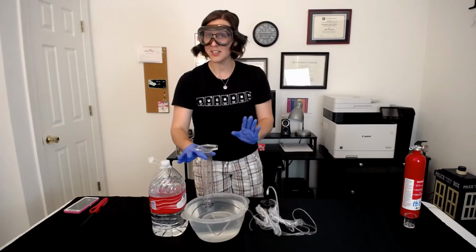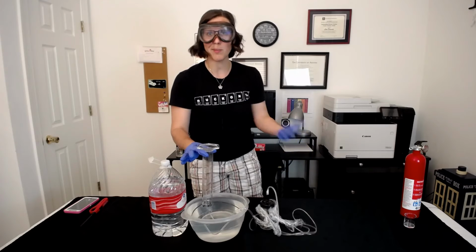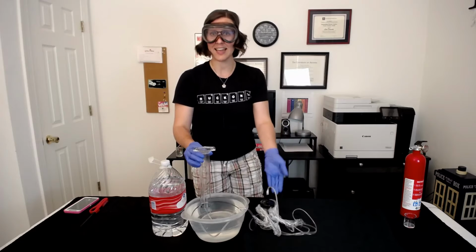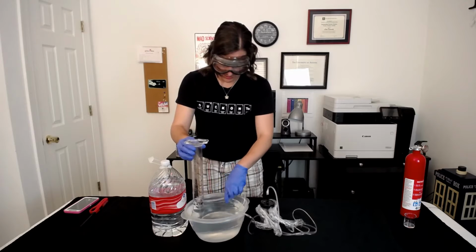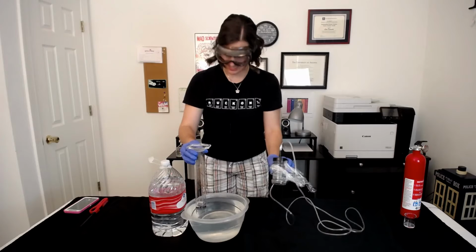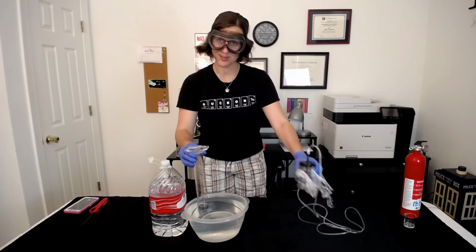The next thing you need to do after the reaction has come to completion, as far as you can tell, once the bubbles have ceased, or the magnesium is completely dissolved, or anything like that that lets you know that this reaction is done, is take our tubing out from the graduated cylinder and move the reaction vessel away, which is still warm, by the way. Again, another sign that this was an exothermic reaction.